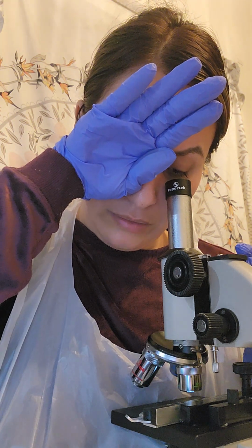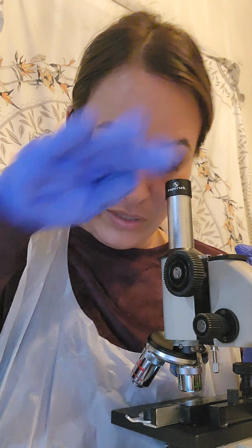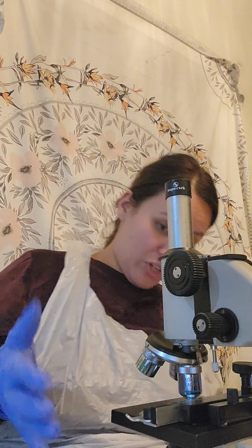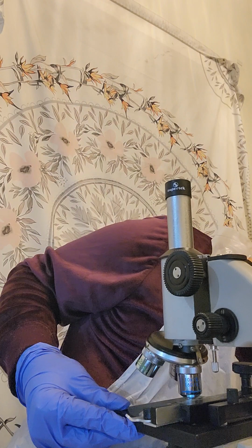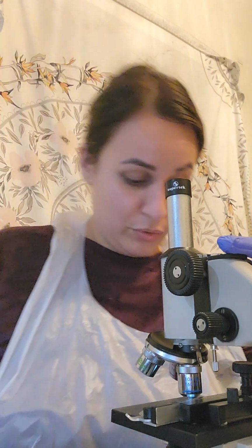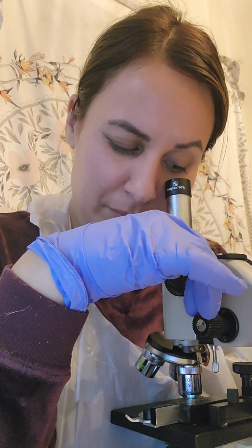So yeah, I see a couple of red splotches. This is for the amoeba that I'm looking at. Let me make sure that I don't need to do anything else. Now it's asking to switch to medium. That was pretty cool, looking at it from just the 4X. So now I went ahead and switched it over to the medium power. I'm going to take a look here.